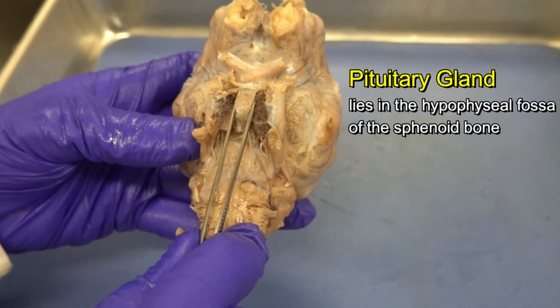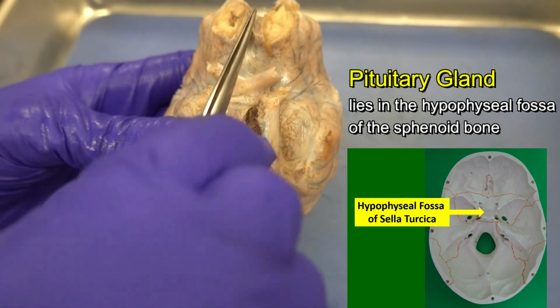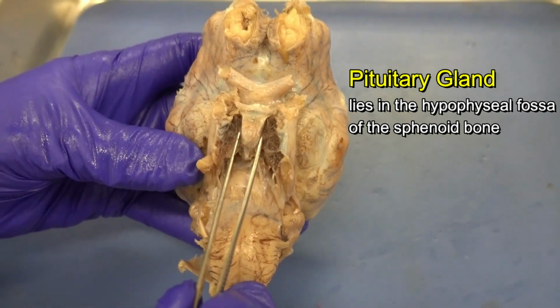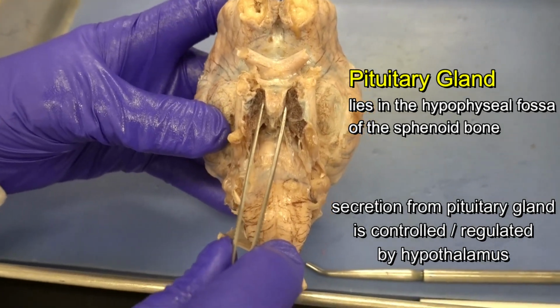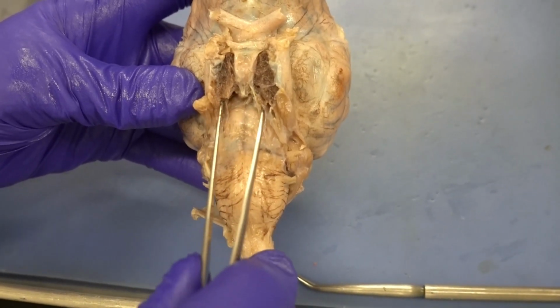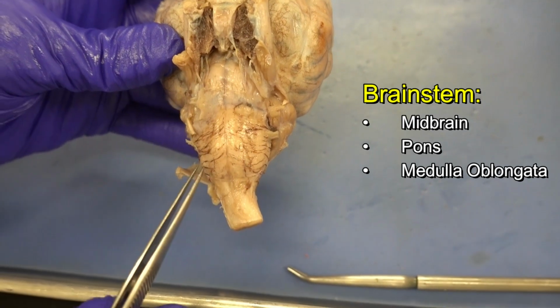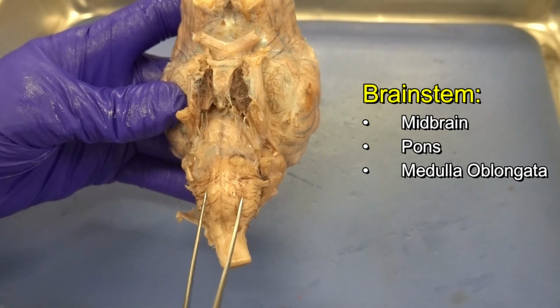When I move posteriorly, I can see this gland, which is the pituitary gland. Recall, the pituitary gland sits exactly below the hypothalamus. So after I dissect the brain through the mid-sagittal plane, we can locate the pituitary gland below the hypothalamus. Clearly, it should make sense that secretion from the pituitary gland is controlled by the hormones that the hypothalamus releases. And then when I move here, I start with the brainstem. Recall, the part of the brain that is attached to the spinal cord is the brainstem, and specifically the part of the brainstem that is fused to the spinal cord is the medulla oblongata.